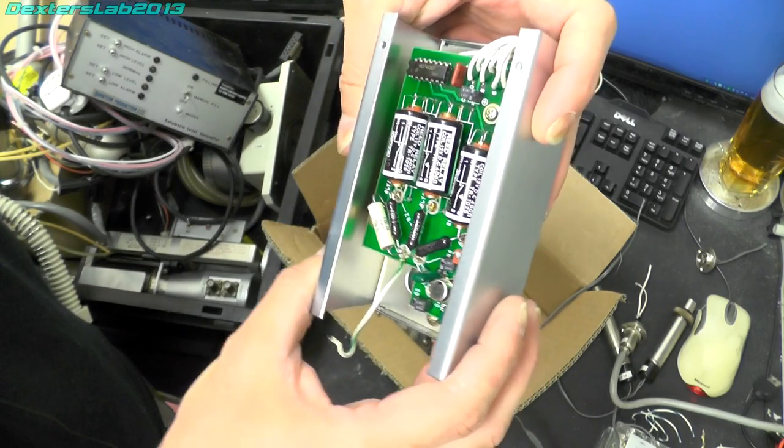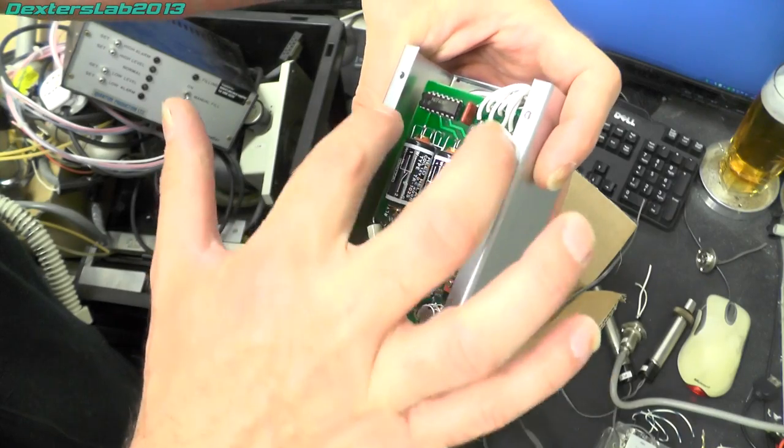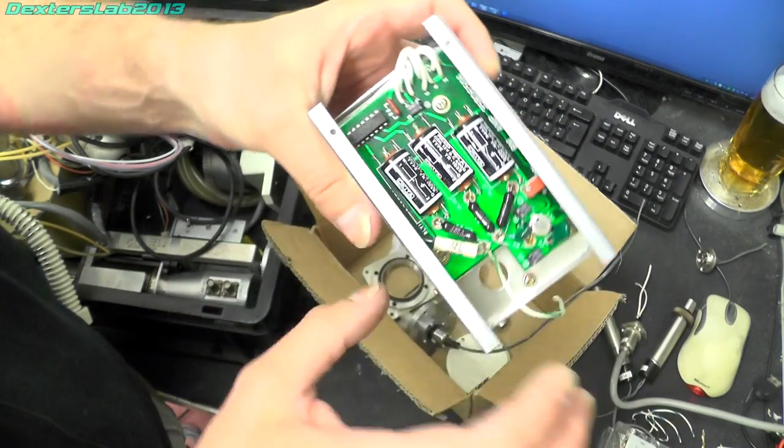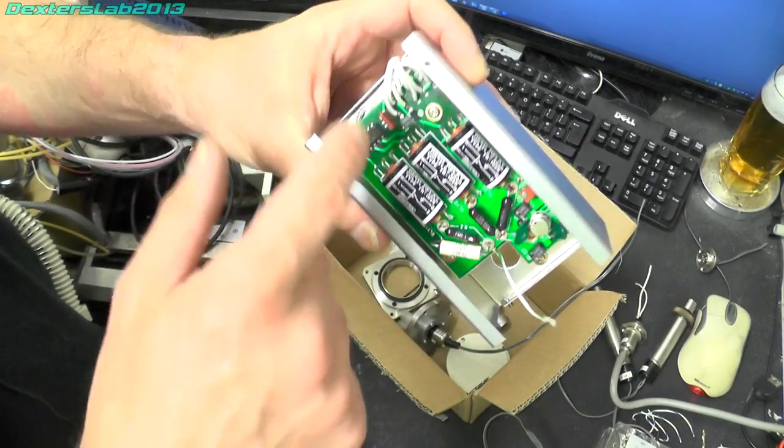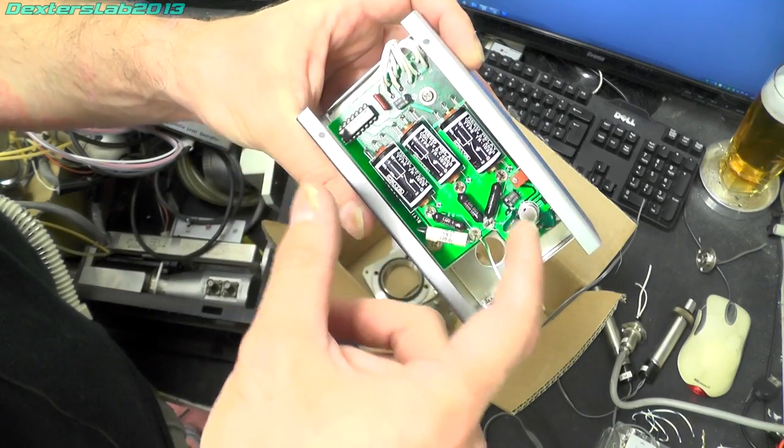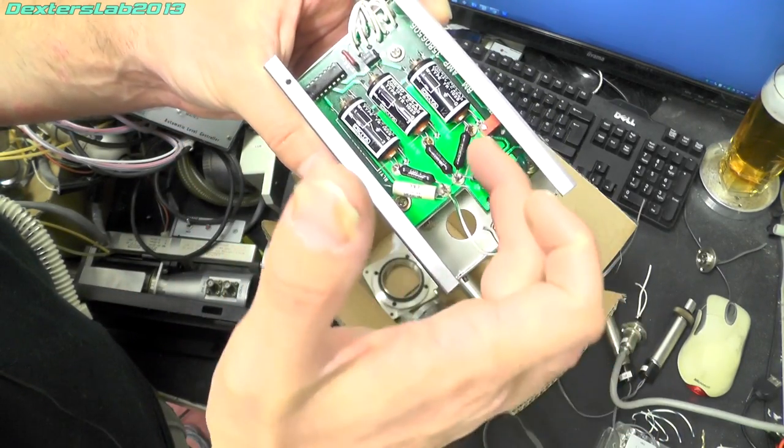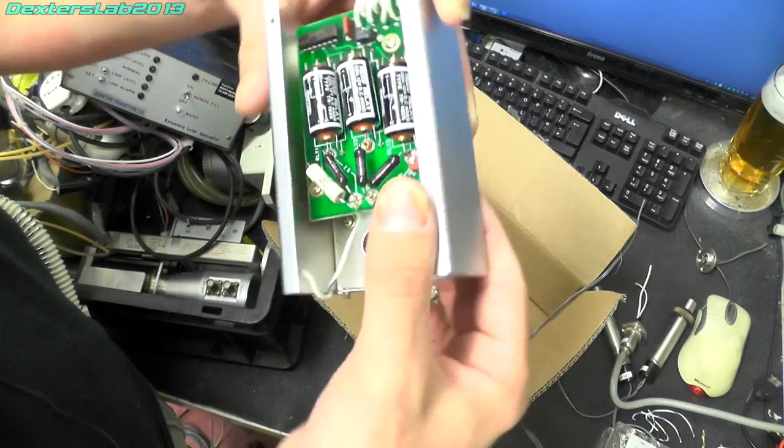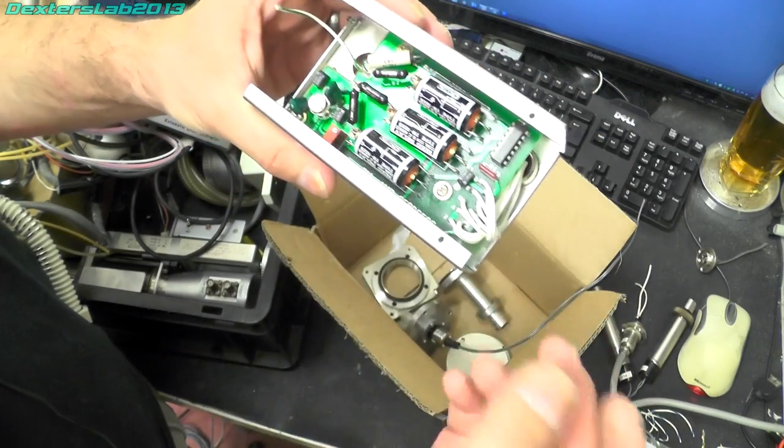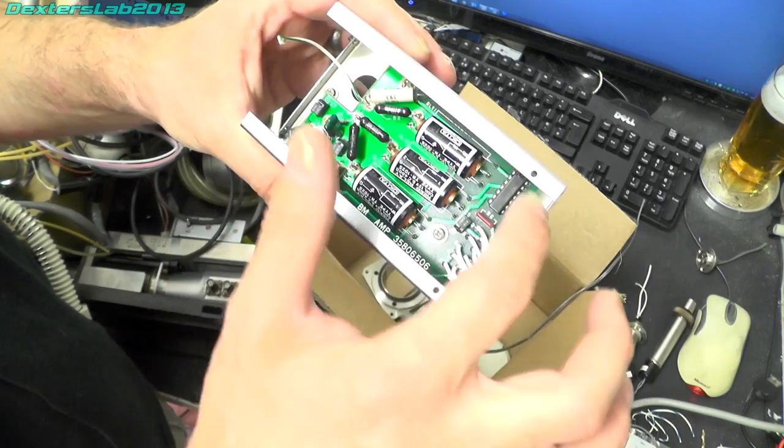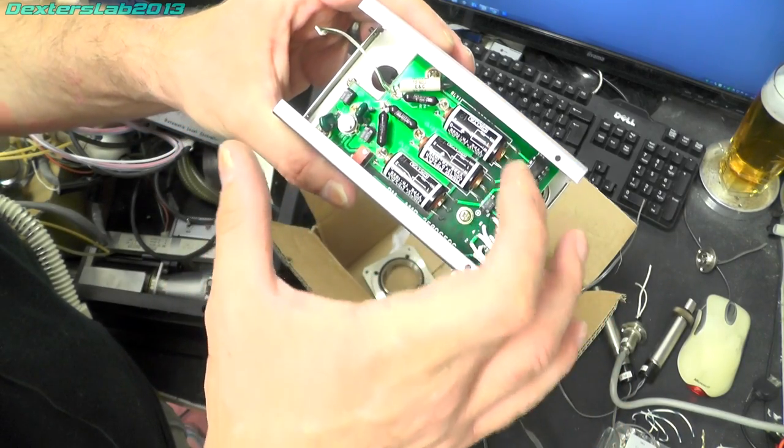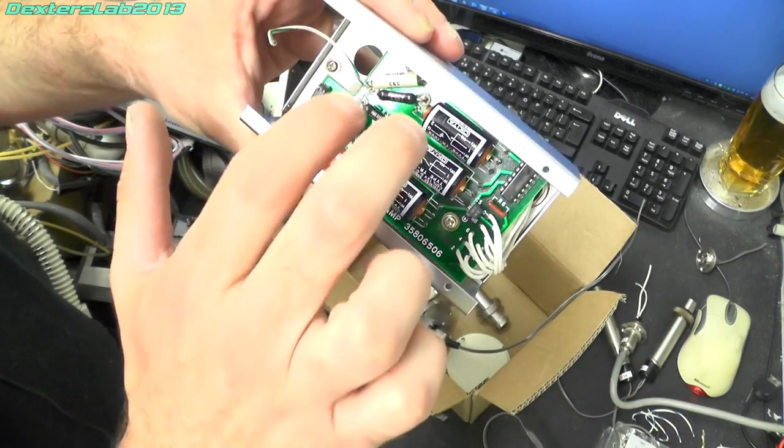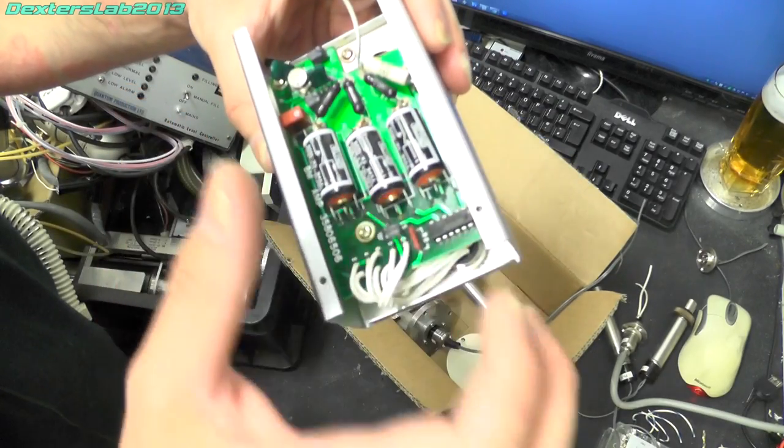I'm not sure what that actually is but there's three outputs going into three relays so I think it's a really simple system to be able to switch each of these relays in and out and select one of these attenuation resistors. There's four in total so presumably that one is just connected straight through and then this connects in, this one and then this one.